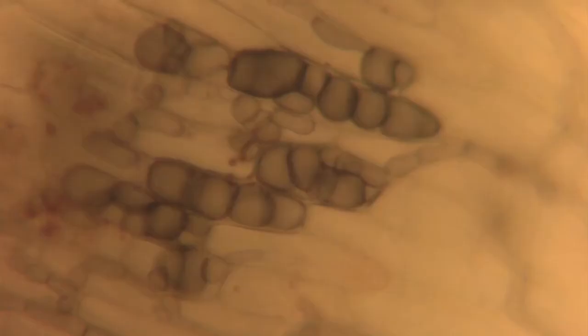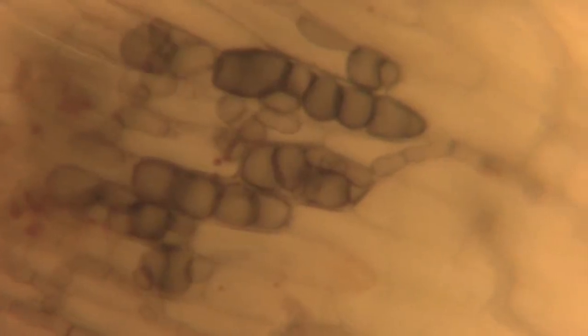When we looked under a microscope at the base of the plant, we see growth cessation structures and also dark hyphae running down the plant, which are ectotrophic hyphae — what we call dark ectotrophic hyphae. This classifies the whole group of fungi, normally ascomycetes: summer patch, take-all patch, and those types of organisms that attack the roots.